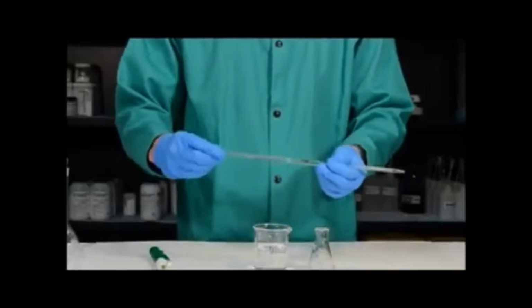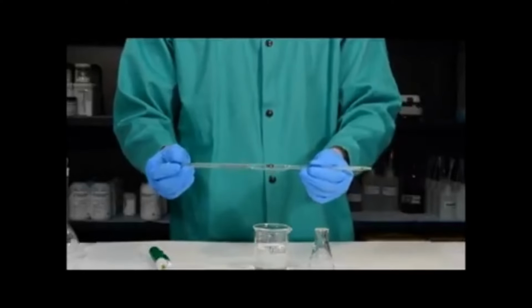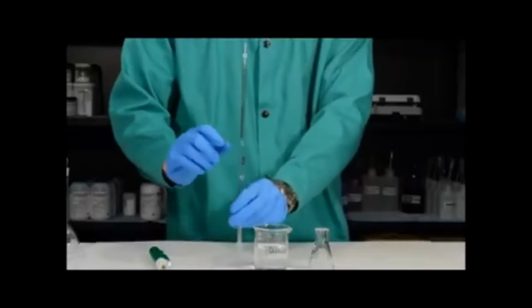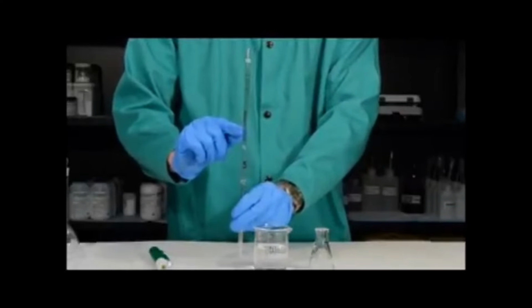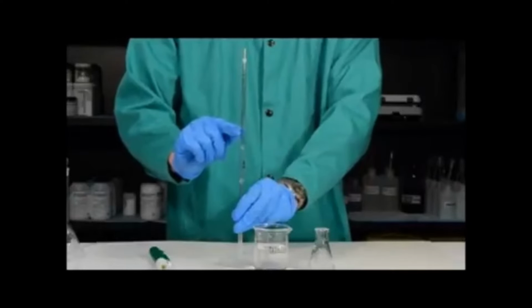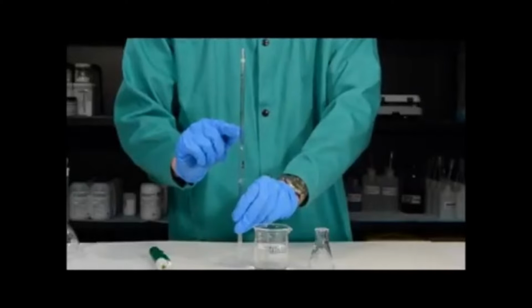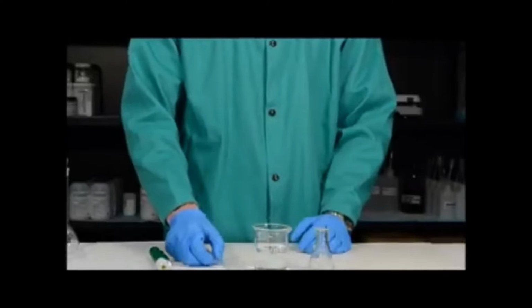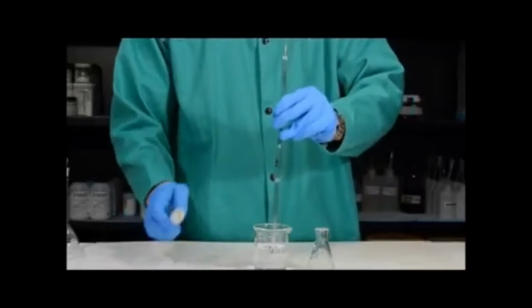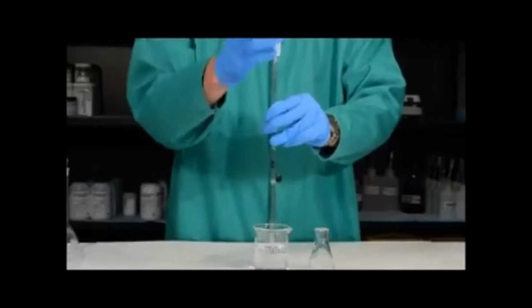As mentioned, a 5 milliliter volumetric pipette has just one job: to transfer 5 milliliters of liquid into another container. You'll see here that it has what's called a calibration line. The calibration line is the only marking on a 5 milliliter pipette. This is the level at which you want the liquid to be in order to deliver 5 milliliters. Now that I have all the tools that I need to use the volumetric pipette, I simply want to place the pipette into the beaker and place the pipette pump on top.